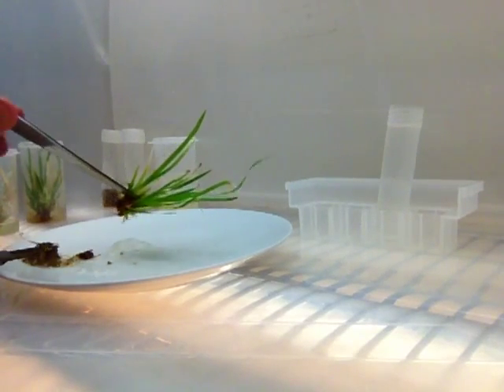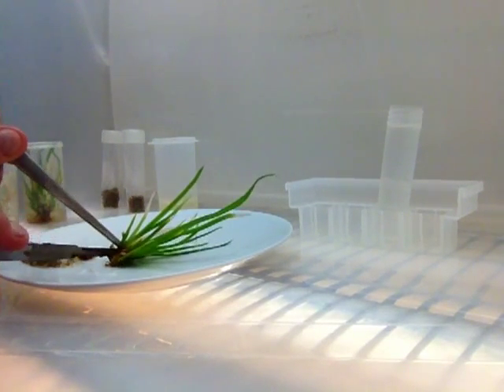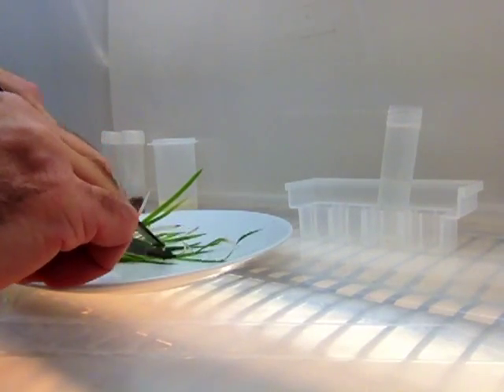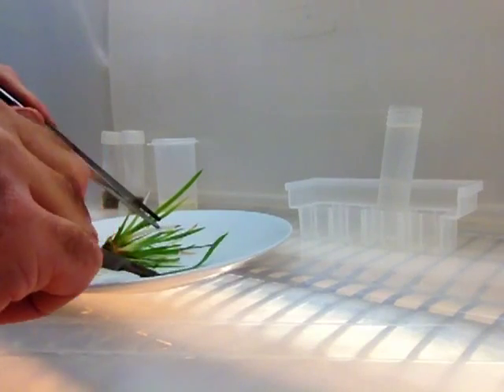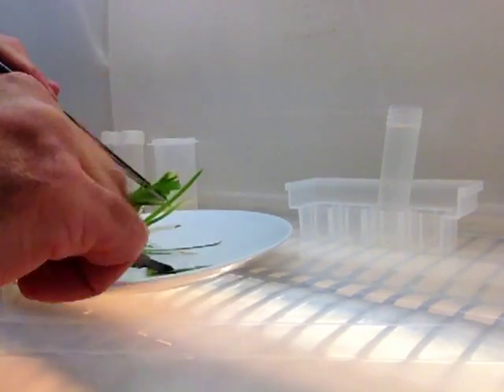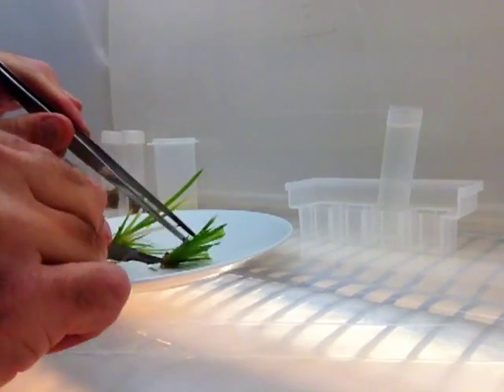See that mess we got there? Just going to sort of split it down the middle. And also to make it easy, I'm just going to trim these tops so they stay out of the way. We call this giving it a haircut.